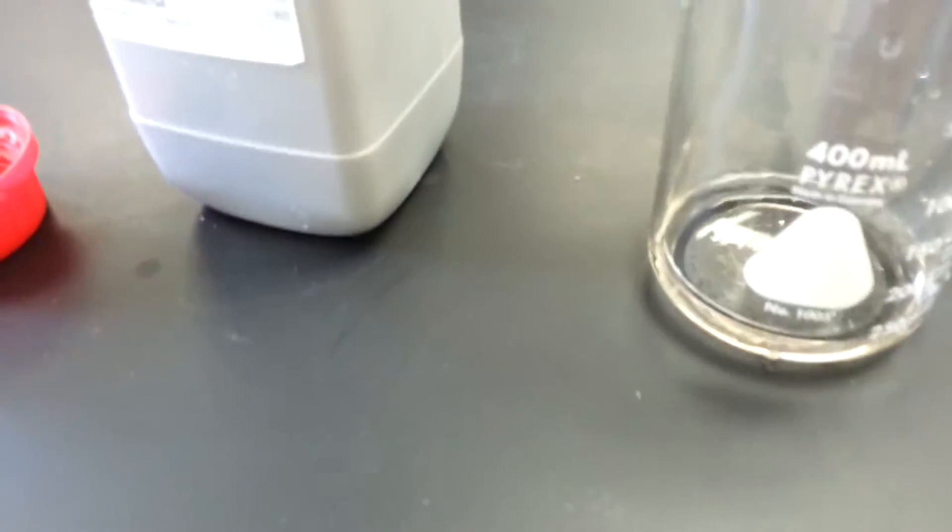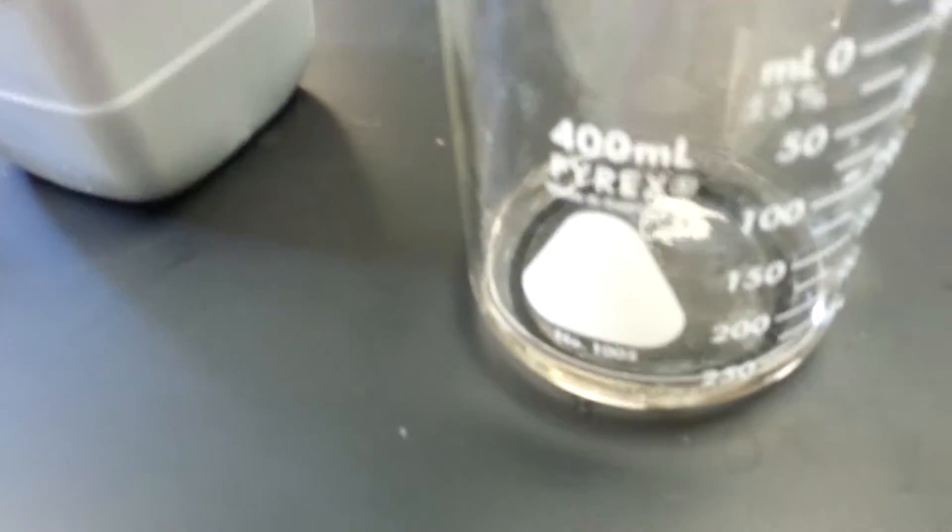In this video, we're going to neutralize acid with base. The acid in here is about 50 milliliters. You use these numbers to measure—50 milliliters.